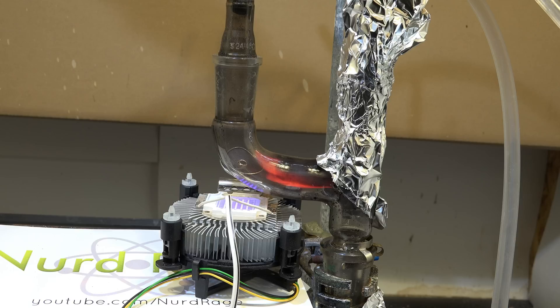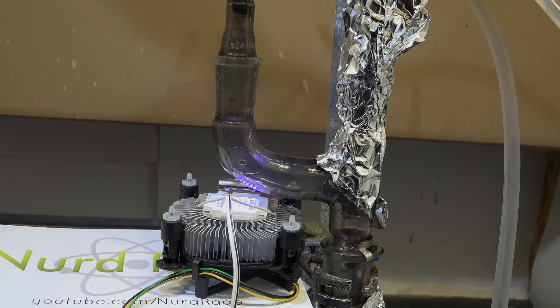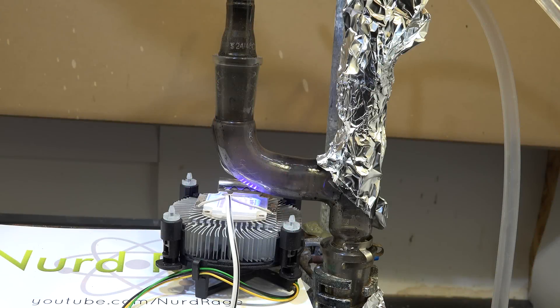All the oxygen has been purged out by the continual reaction but chlorine itself is a powerful oxidizer and thus it can support combustion in some instances. The UV light is initiating the reaction. For our product we don't want this to happen so we'll need to stop it. The process is similar to stopping combustion with regular fire. We just slow down the rate of chlorine addition to create a mixture too rich in fuel to burn.